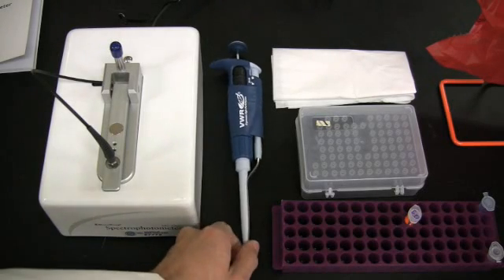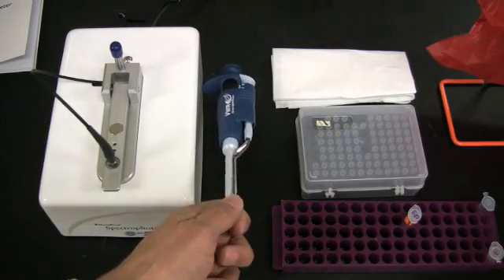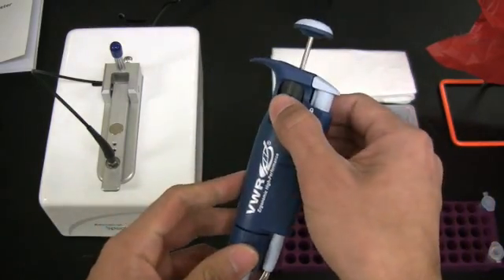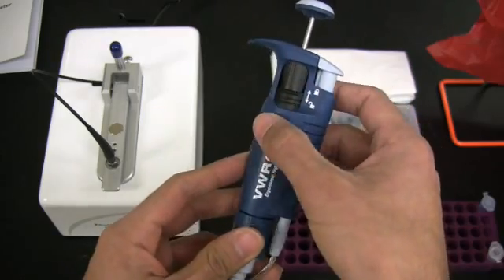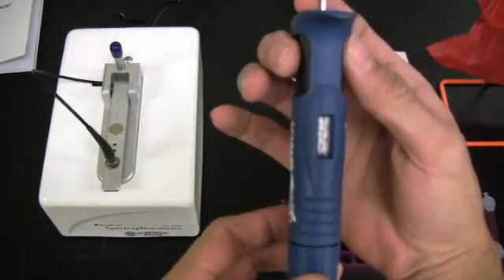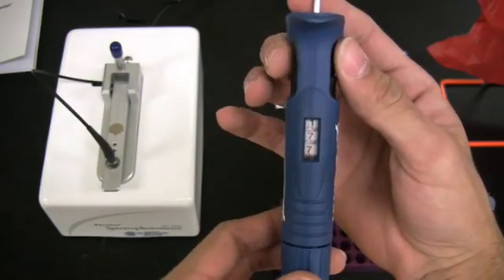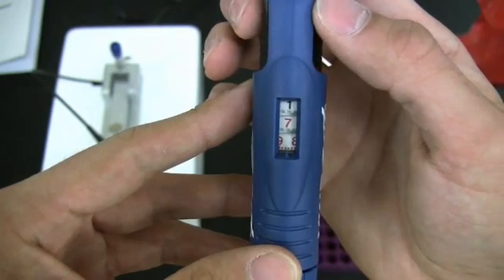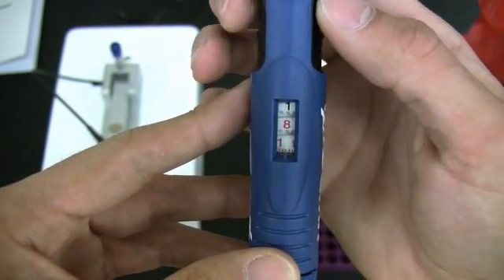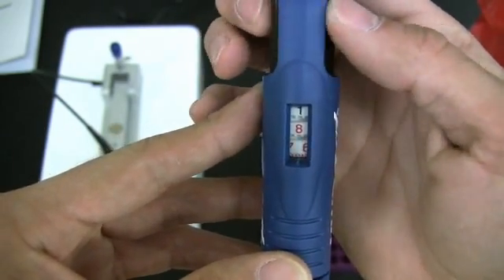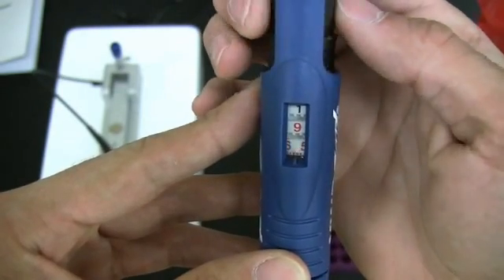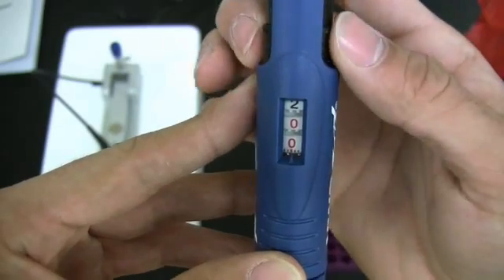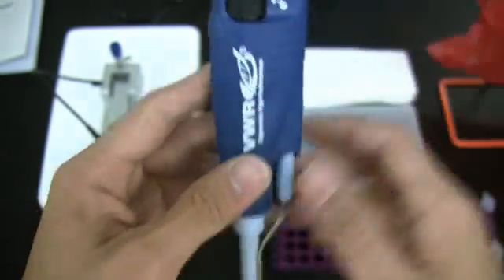We will only be pipetting material in 2 µL volumes during this procedure, so make sure that the P2 pipetter is correctly set to deliver 2 µL. If you have not used a P2 pipetter, or have trouble remembering how to correctly set the volume, first slide the locking collar on the pipette down. This will unlock the pipette. Twist the knob of the plunger until the display reads 2, 0, 0. On most P2 pipettes, the black numbers denote whole µL.